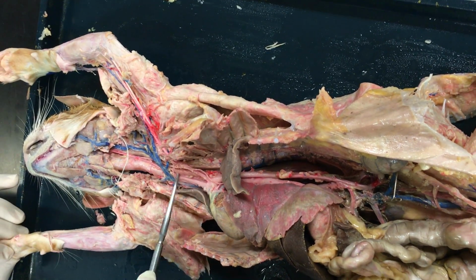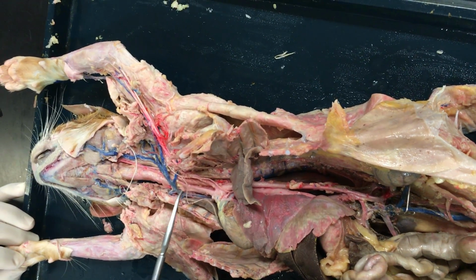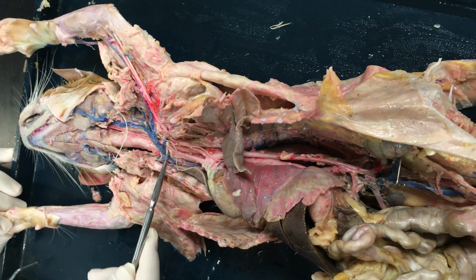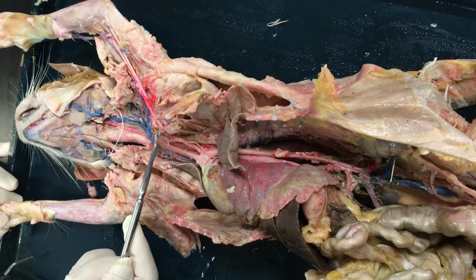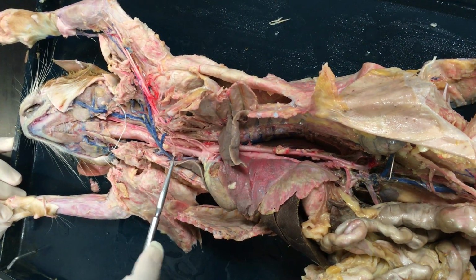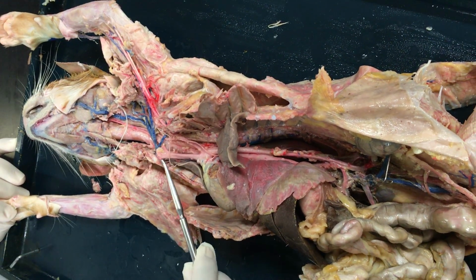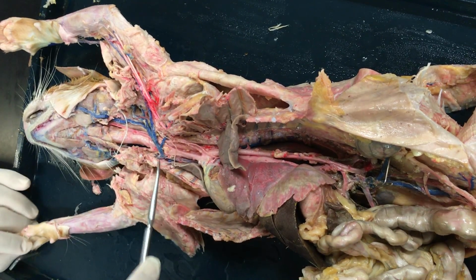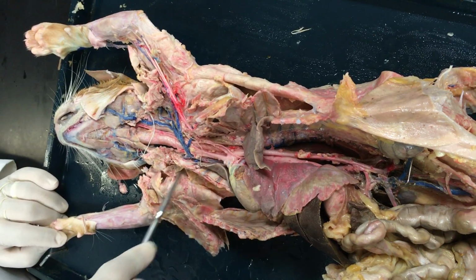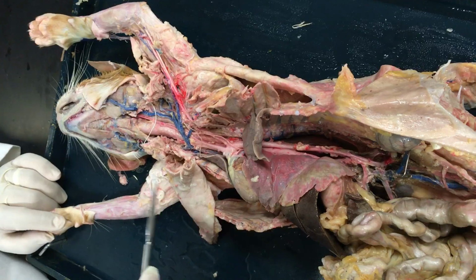So on the cat, if we continue to follow the brachiocephalic trunk, you'll see that there are three branches here coming off of that brachiocephalic trunk behind the vein. Going from left to right, you're going to have your left common carotid. In the middle here, you would have the right common carotid. And then finally, the third and final branch here, all the way to the right side, is your right subclavian artery. Now, if we follow that right subclavian out beyond the rib cage, it becomes the right axillary, which is not visible here, and then the right brachial as it moves into the brachium. So just be aware of that.